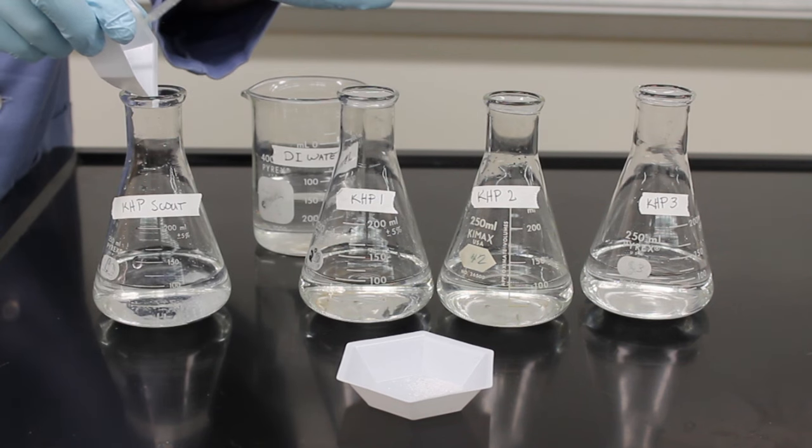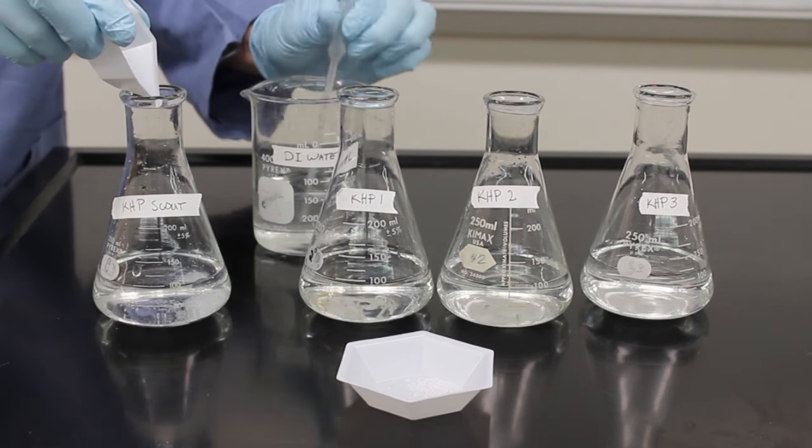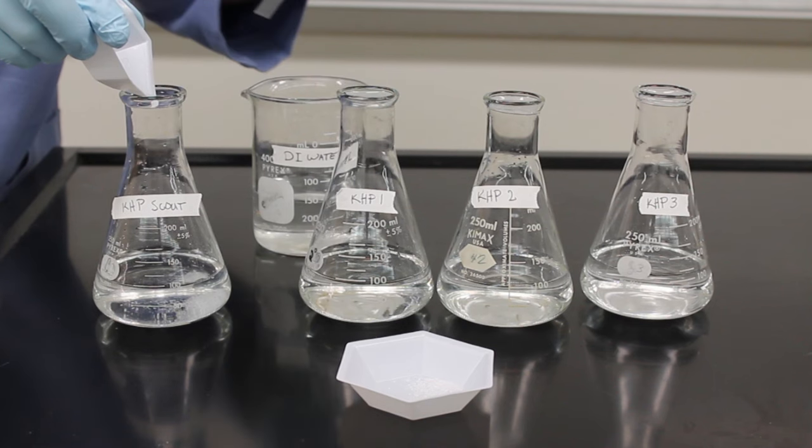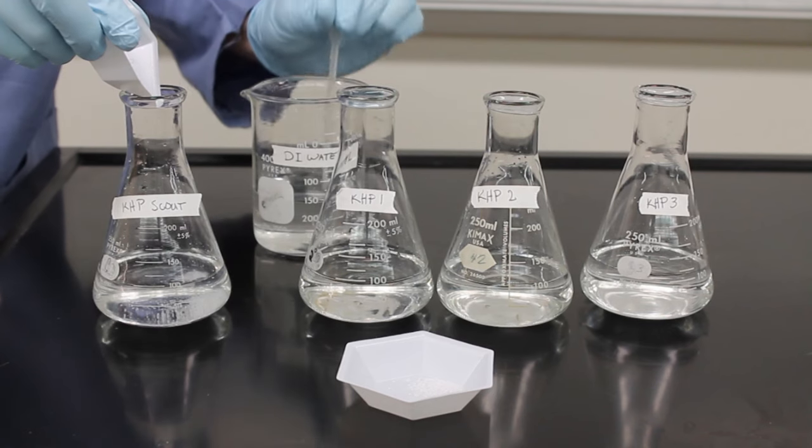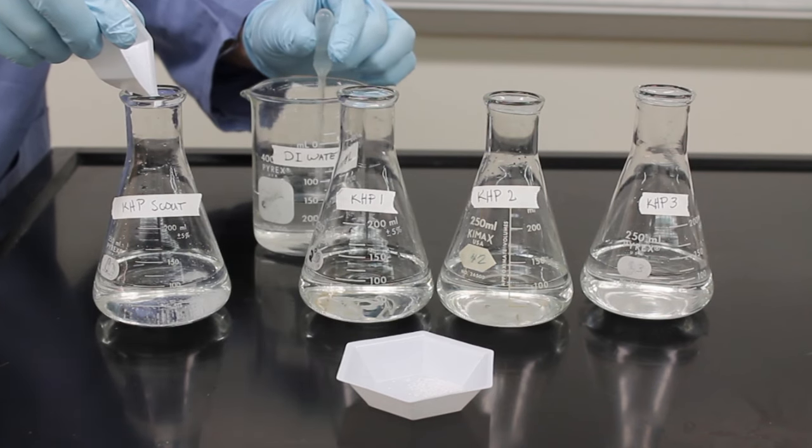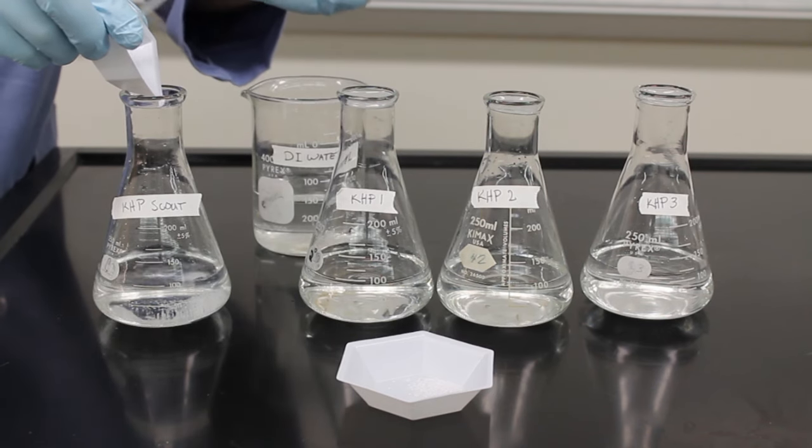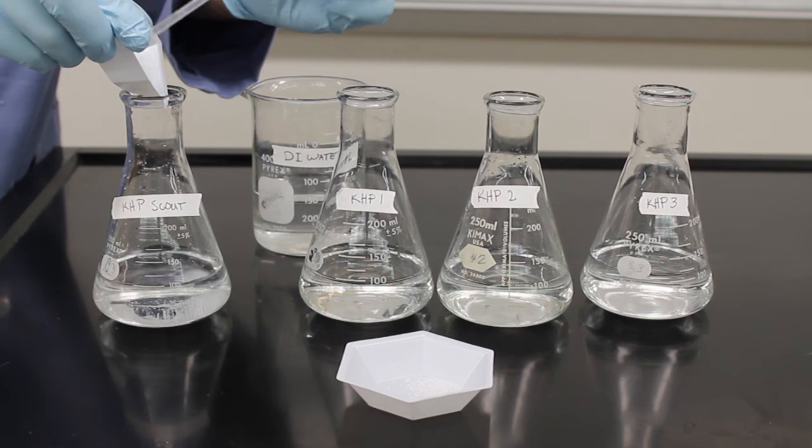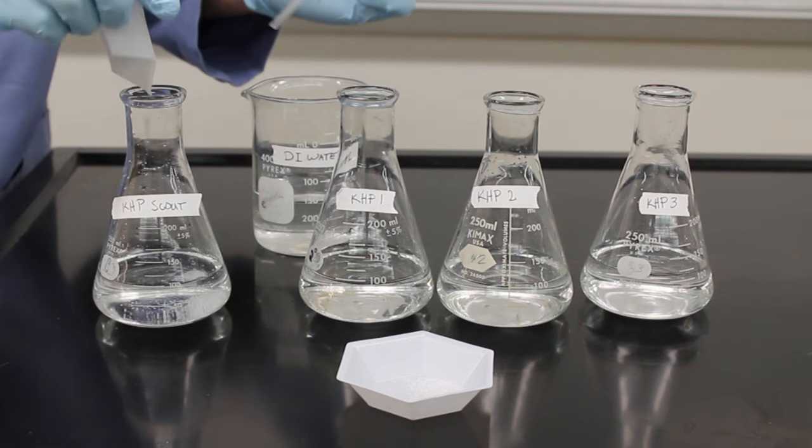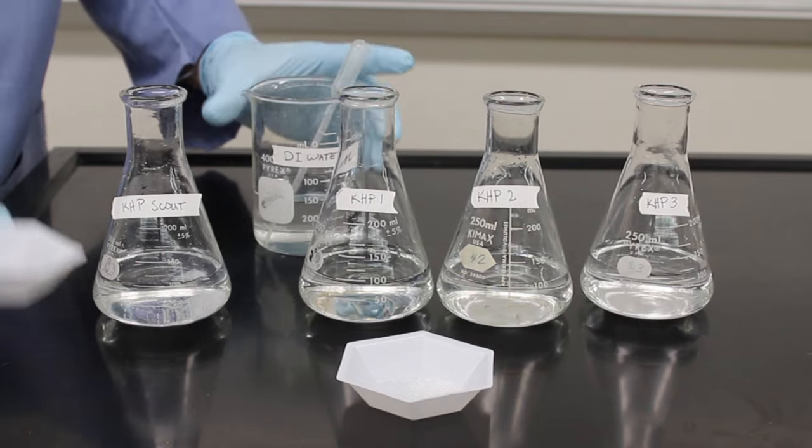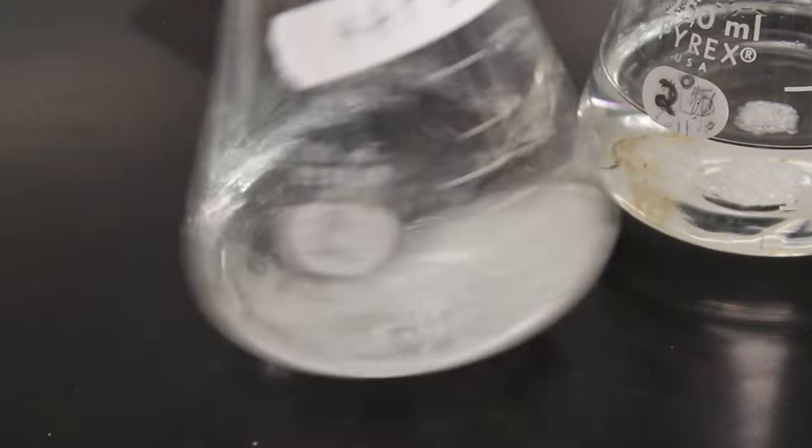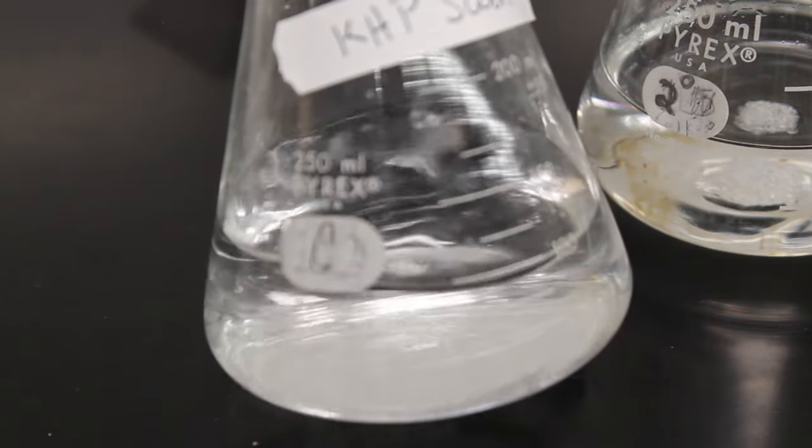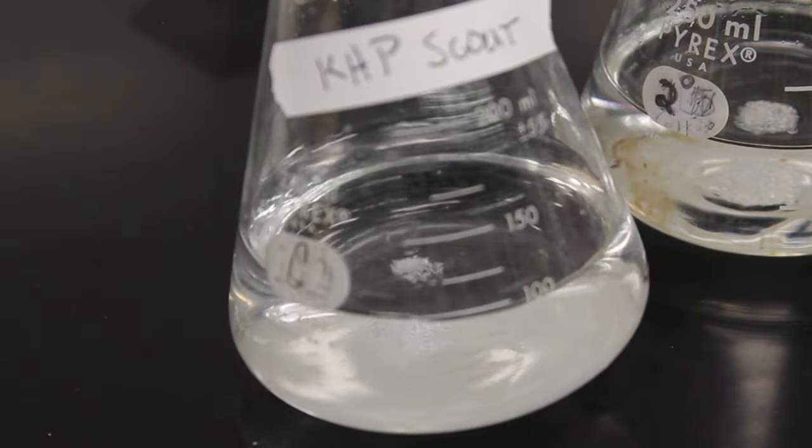Another technique that you could use is called massing by difference. See the description below for a link to the balance video for this technique. KHP may take a while to dissolve, but it is important to make sure it is fully dissolved before you start your titrations.